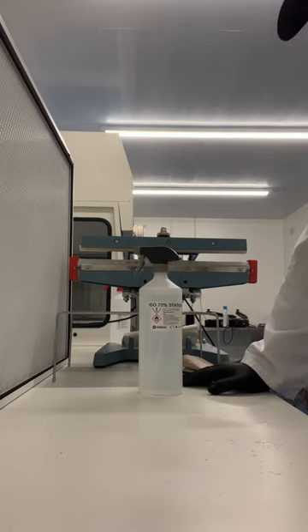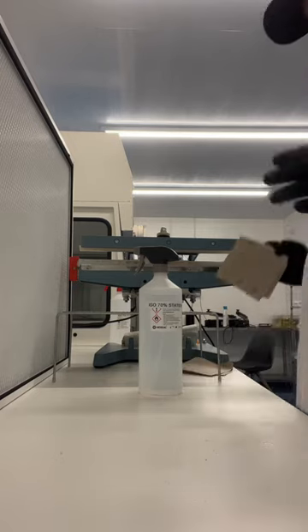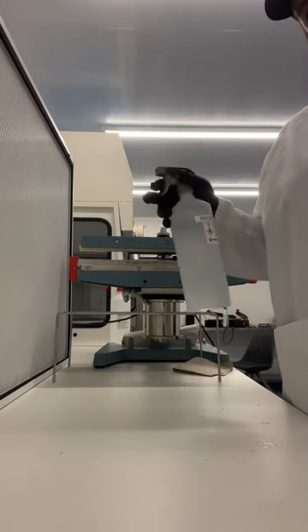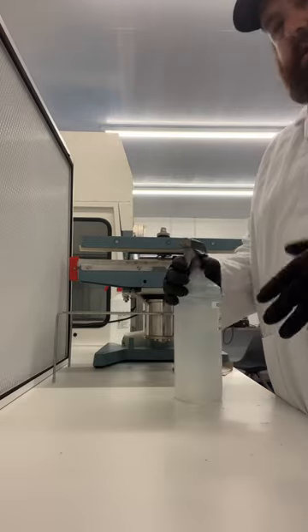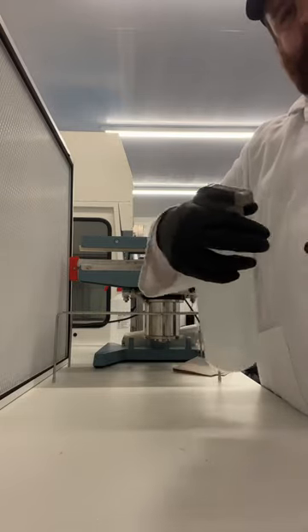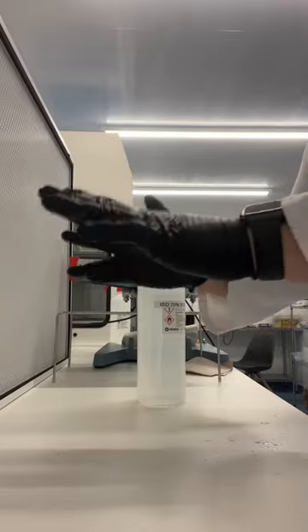Every time we bring a new Presto or anything and start unloading bags, we do a clean-down in between. One thing we don't do: we don't spray toward the filter. So if I'm cleaning down my hands while we're working, I'll spray away from the filter and wipe my hands down.